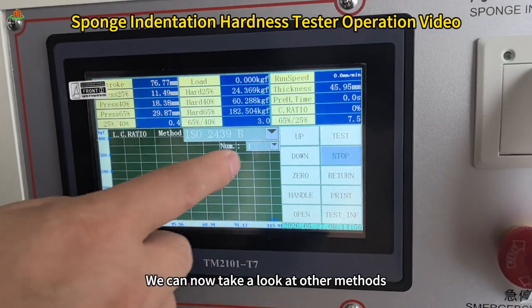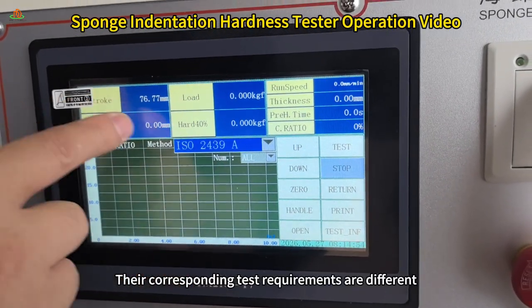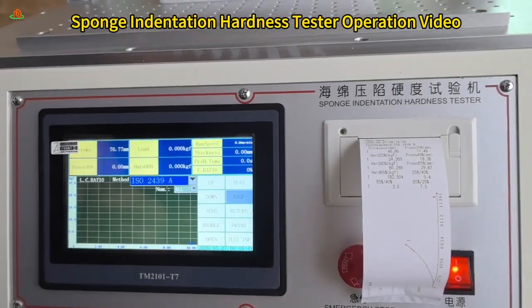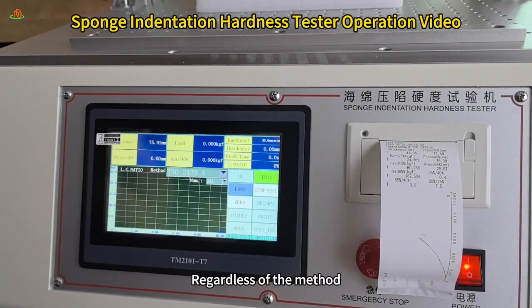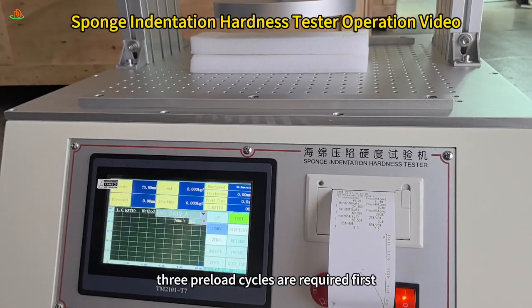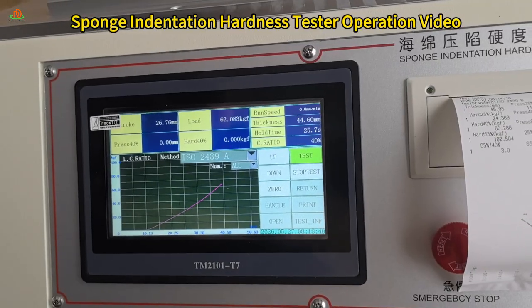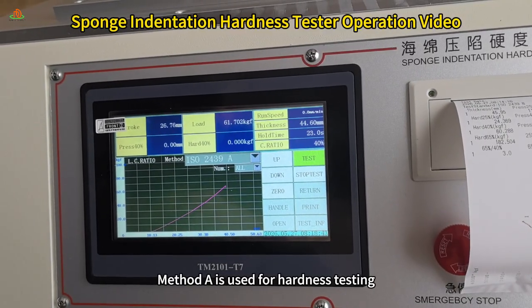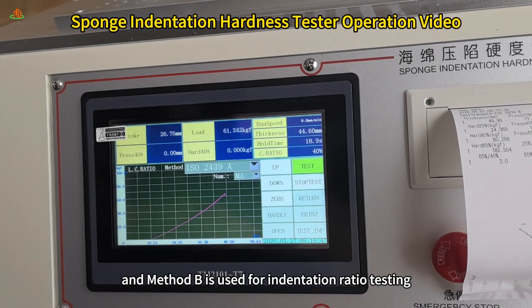We can now take a look at other methods. Their corresponding test requirements are different. Now test method A, click the Test button. Regardless of the method, 3 preload cycles are required first. Method A is used for hardness testing. And method B is used for indentation ratio testing.